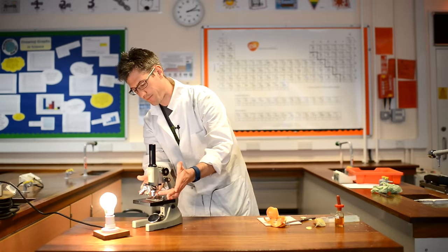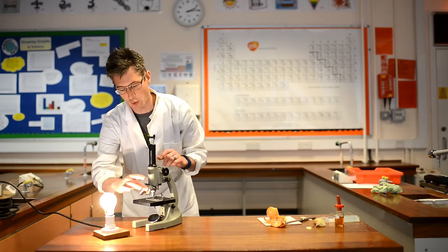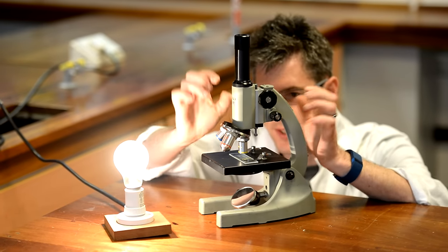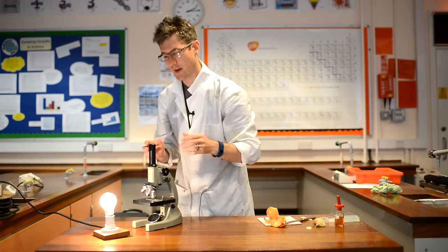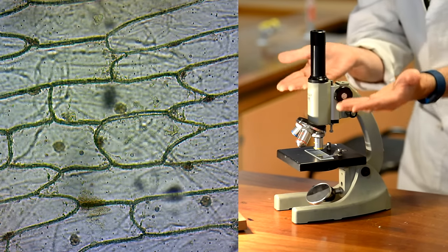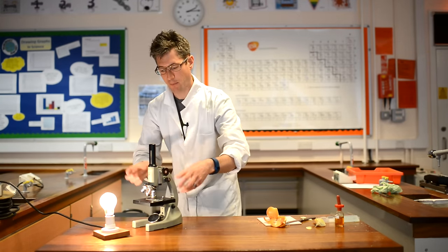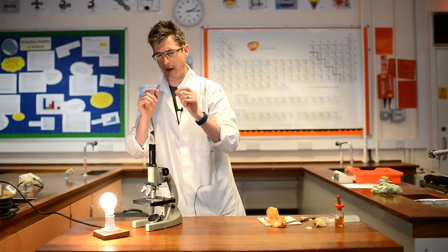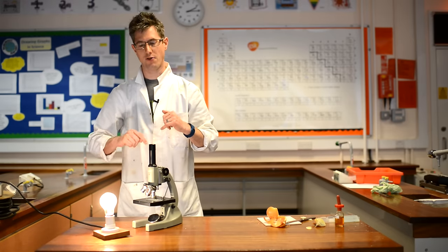It is easier to do it with this small lens. Now that I've got them in view, I can increase my magnification. To do that, all you need to do is spin the next objective in, get down low, and make sure it's not going to touch your slide. There's lots of space there — it's not going to damage the lens or the specimen — and it should roughly still be in focus. Now I just need a very small adjustment. In this case, just bringing the lens up very slightly has brought it back to focus. That is a problem people have — they make big changes to their focus, moving these dials quite a lot whenever they change the lens. It was a very, very small adjustment. I now have the specimen in view at 10 times 10 — 100 times magnification.